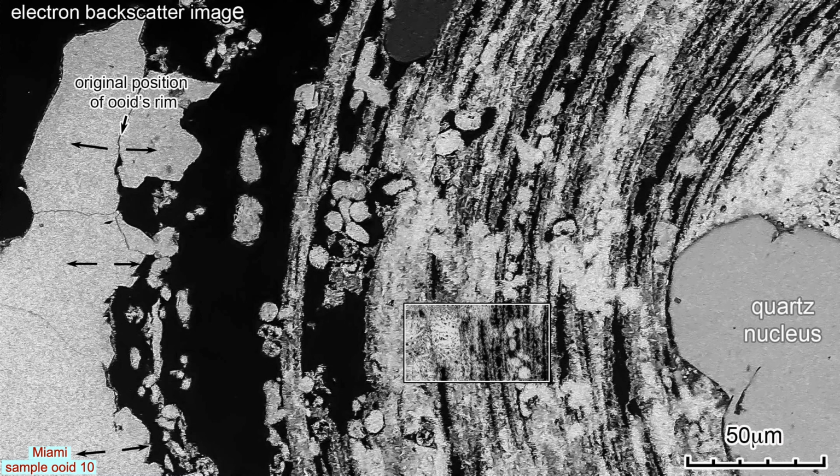The exposed base of the intergranular calcite cement crystals in the outer pore nucleated a second episode of calcite cement growth. These intracortex and intergranular calcite crystals have irregular, sinuous surfaces due to late-stage dissolution. The inner cortex in the box is magnified on the next slide.